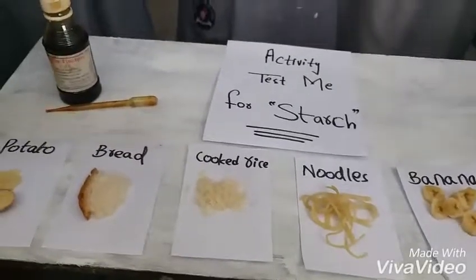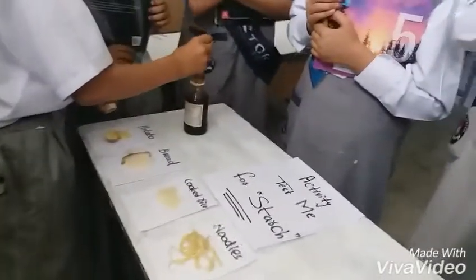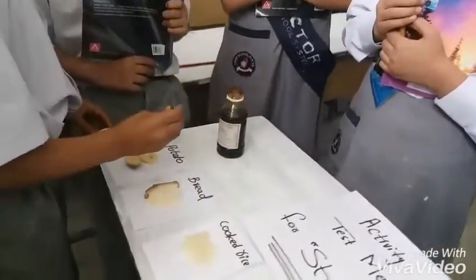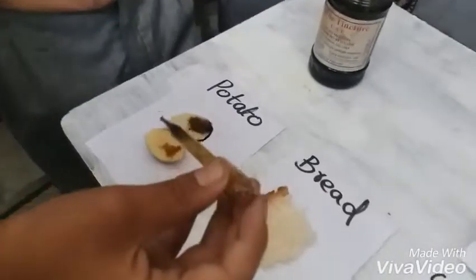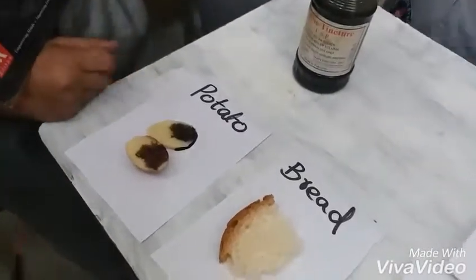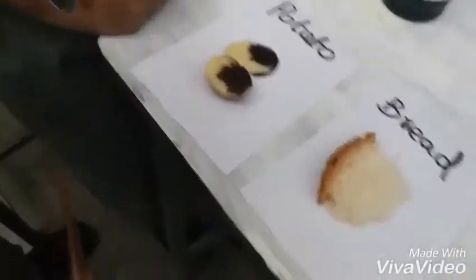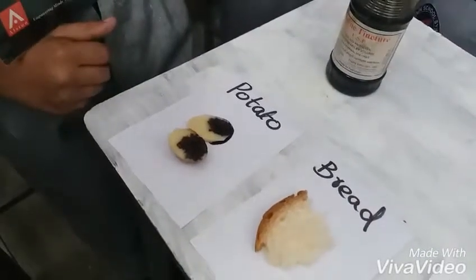Alright, so who will do this first? Raise your hands. Okay, Hamza, take a few drops of this iodine solution and put it on this food item. Which food item is this? Potato. Tell me, has it turned into dark blue color? It's black. Look, this is actually dark blue — yes, it's turned into dark blue. That means there is a presence of starch in this food item.